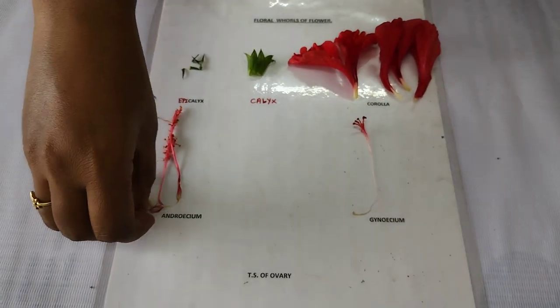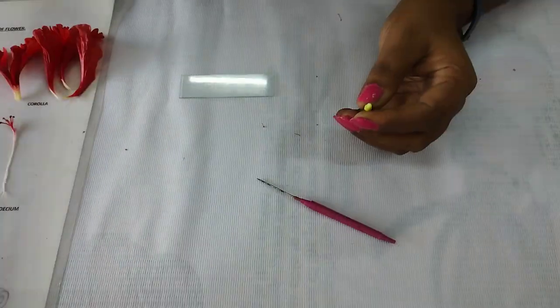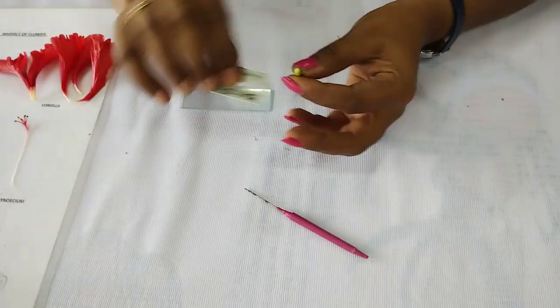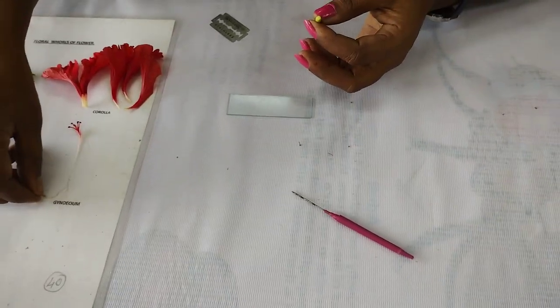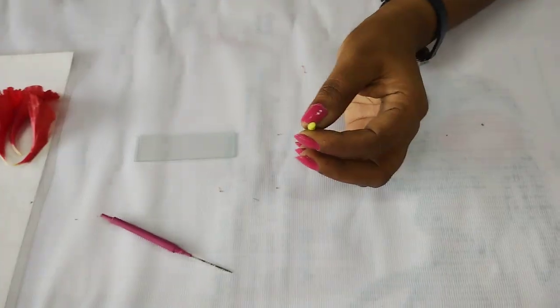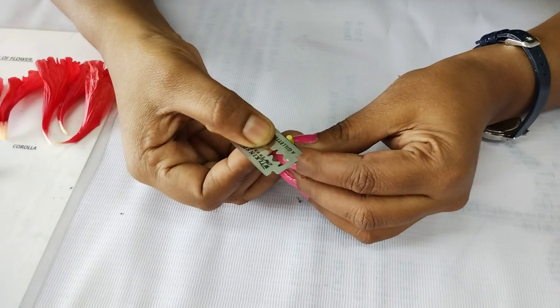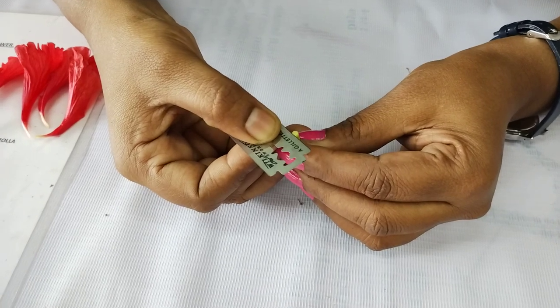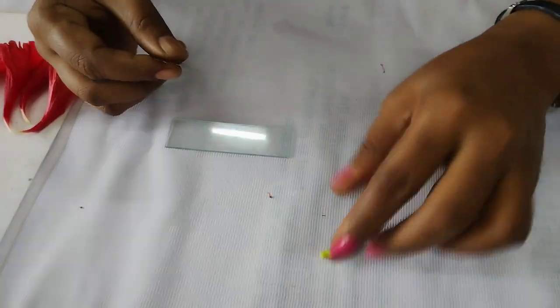Now take a piece of the ovary. This is the ovary. Take one glass slide and one blade. Remove the tip of the ovary. This is the complete gynoecium — the style, stigma, and ovary. Now take a thin transverse section of the ovary in one stroke.